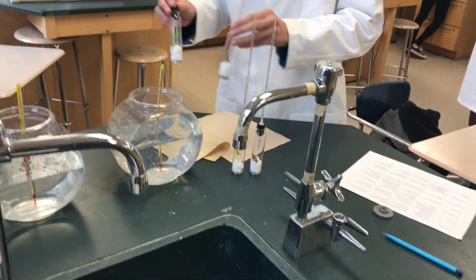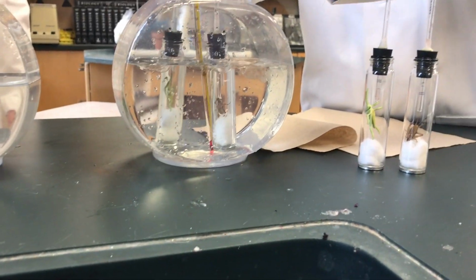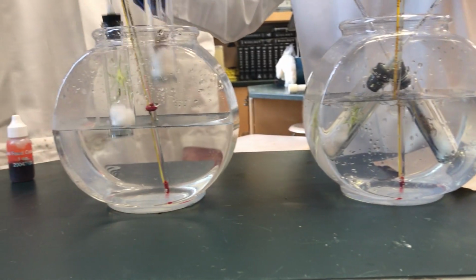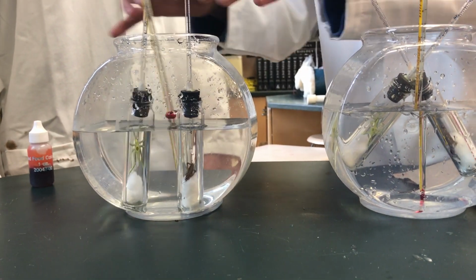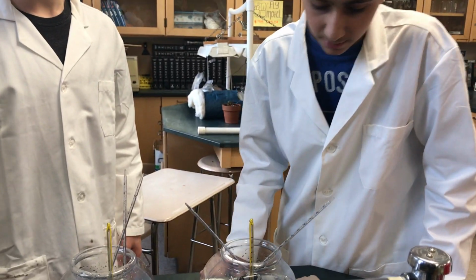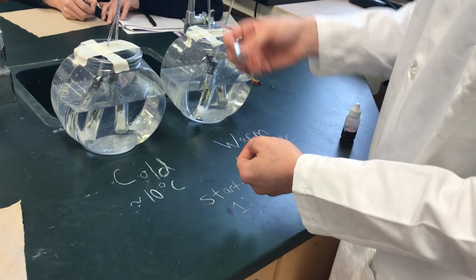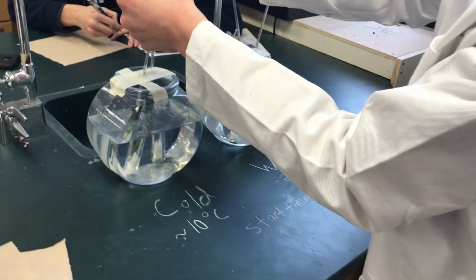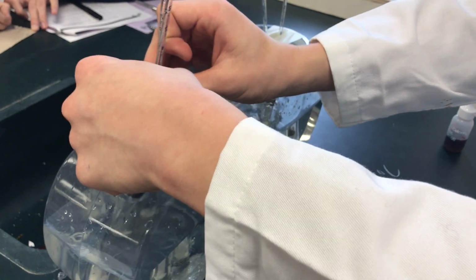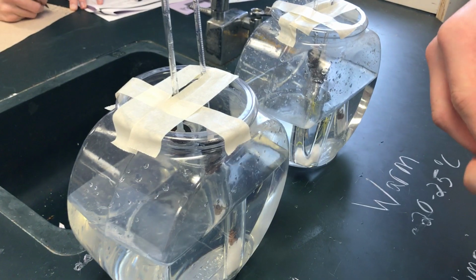Now we'll insert each into the solution where the environment is, and allow them to adjust to the environment temporarily to allow the air temperature to change for around 3 minutes. Okay, now that 3 minutes have passed, we will start to weight down each tube. We shall slide washers, preferably steel, down the tube on top of each canister that holds the crickets.